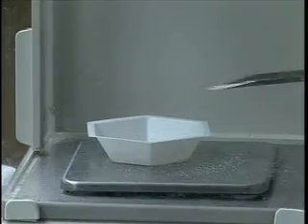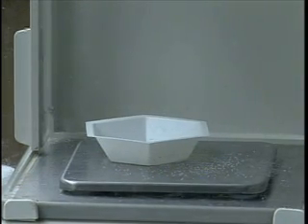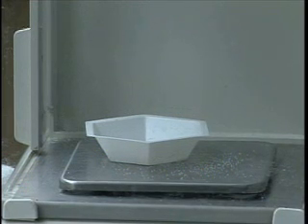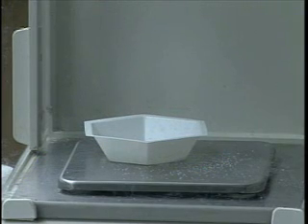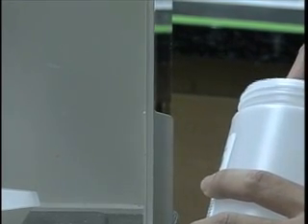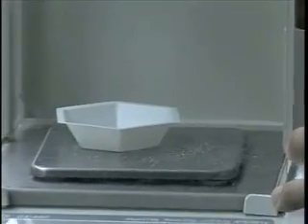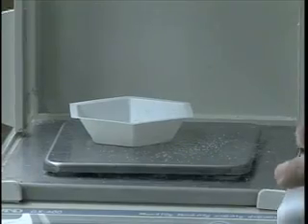So I need 7.455 grams, but that's so precise. Oh no, I'm short by 0.1 grams. This is going to be so nerve wracking. This doesn't matter — this is only a lab. I want to play some ping pong now. Hurry up. No, you can't do that. Just keep your cool and take your time. That 0.1 gram will no longer make it 1 molar, would it? And Edwards would be so sad.